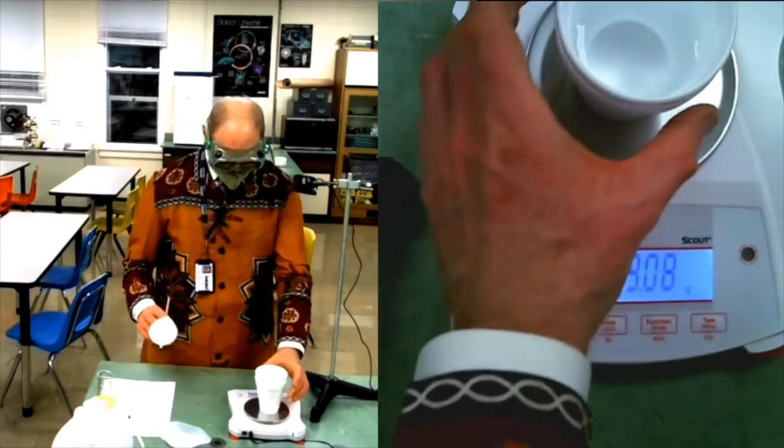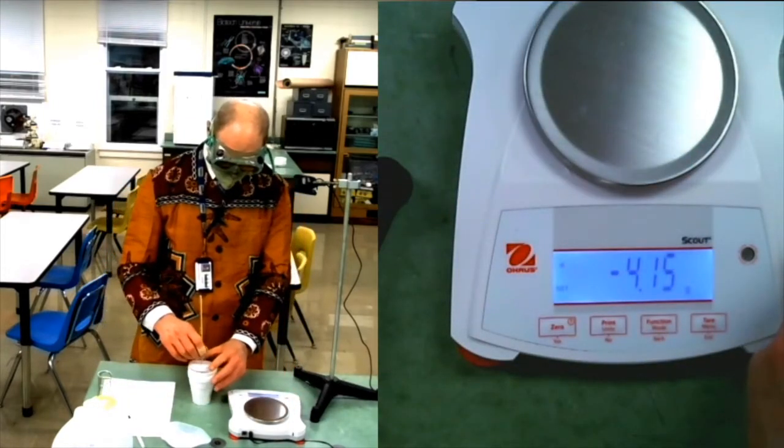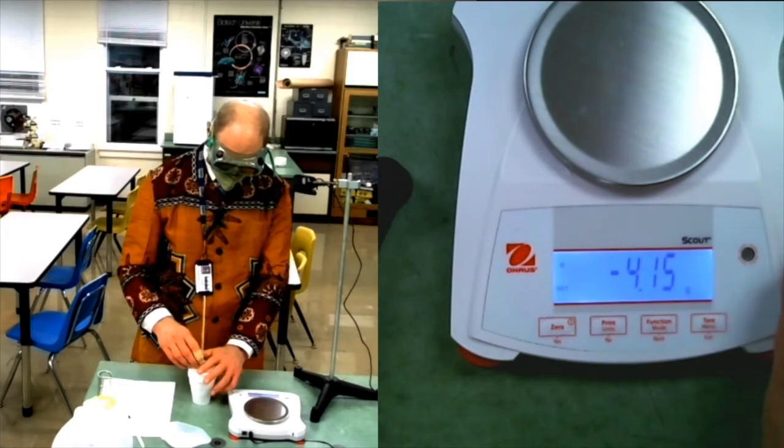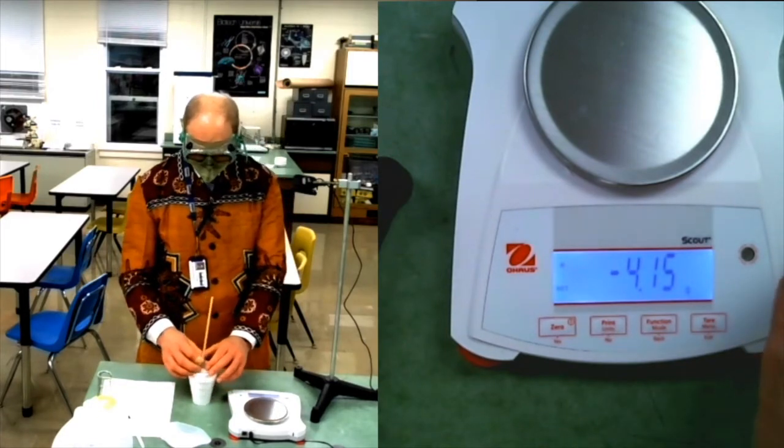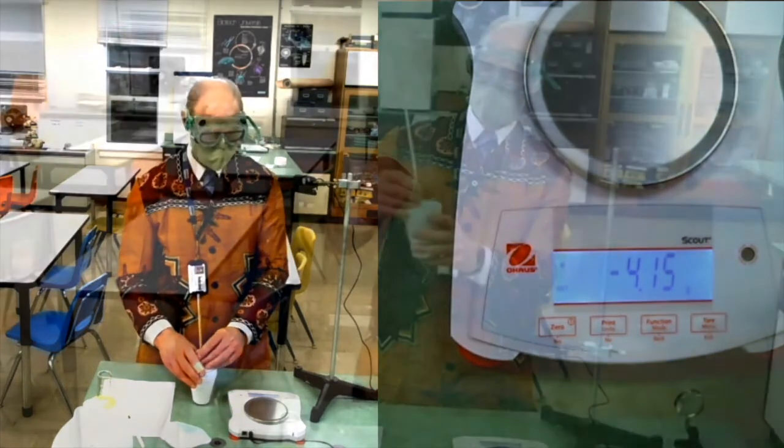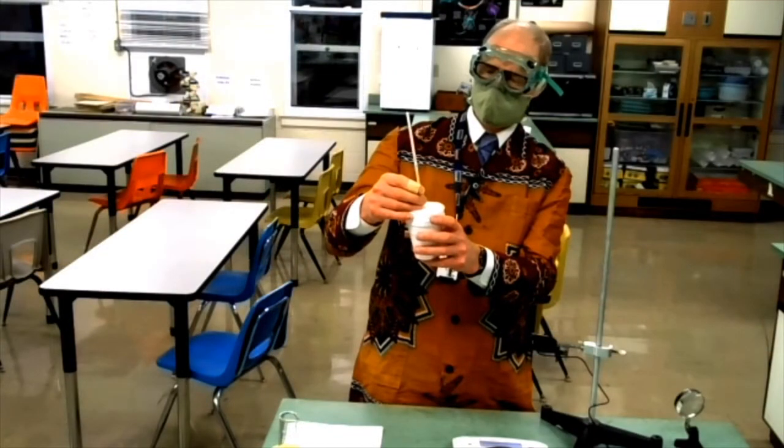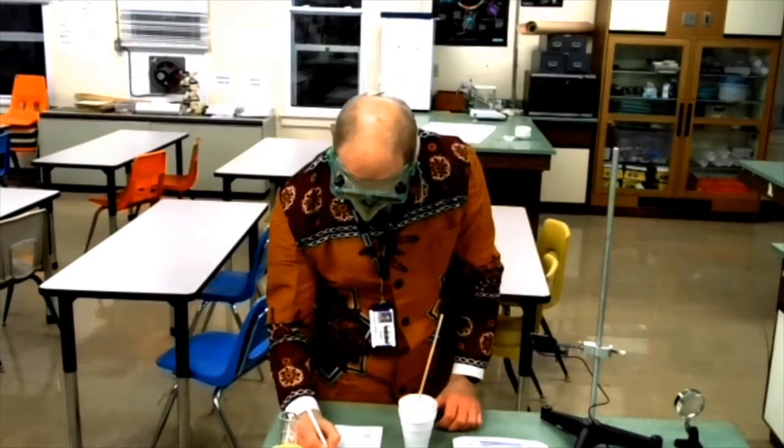And the initial temperature of the water. I'm going to call this 21.1 degrees Celsius.